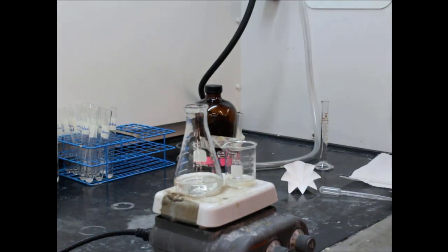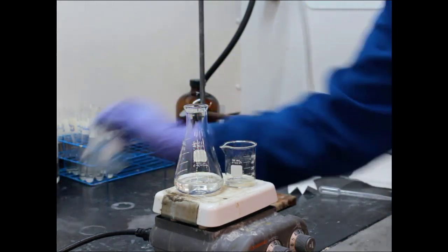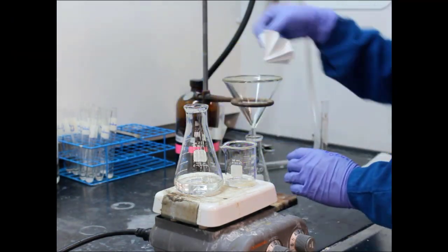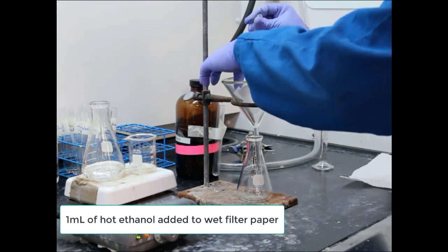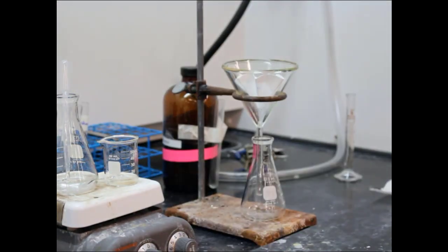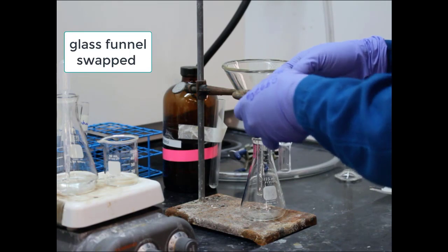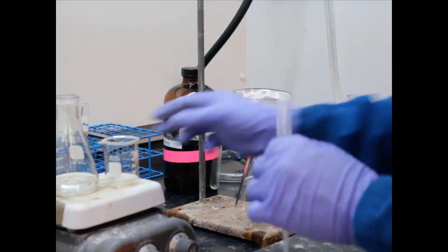All right, so setting up an Erlenmeyer flask with a glass funnel. All right, now they're going to come to the realization that this is an awful filter to use, an awful funnel to use for this type of procedure. And so you're going to see they're trying to wet the filter paper to get it to kind of stick and retain shape. So instead they actually are swapping it to a different funnel. Okay, and this one's going to work a lot better.